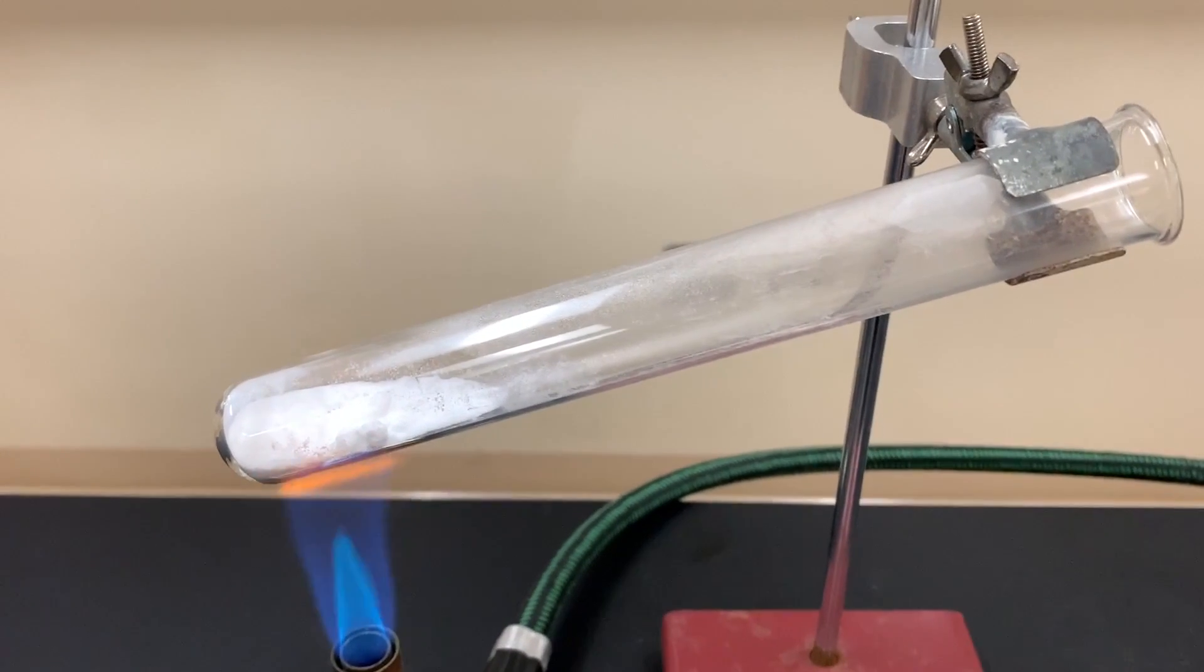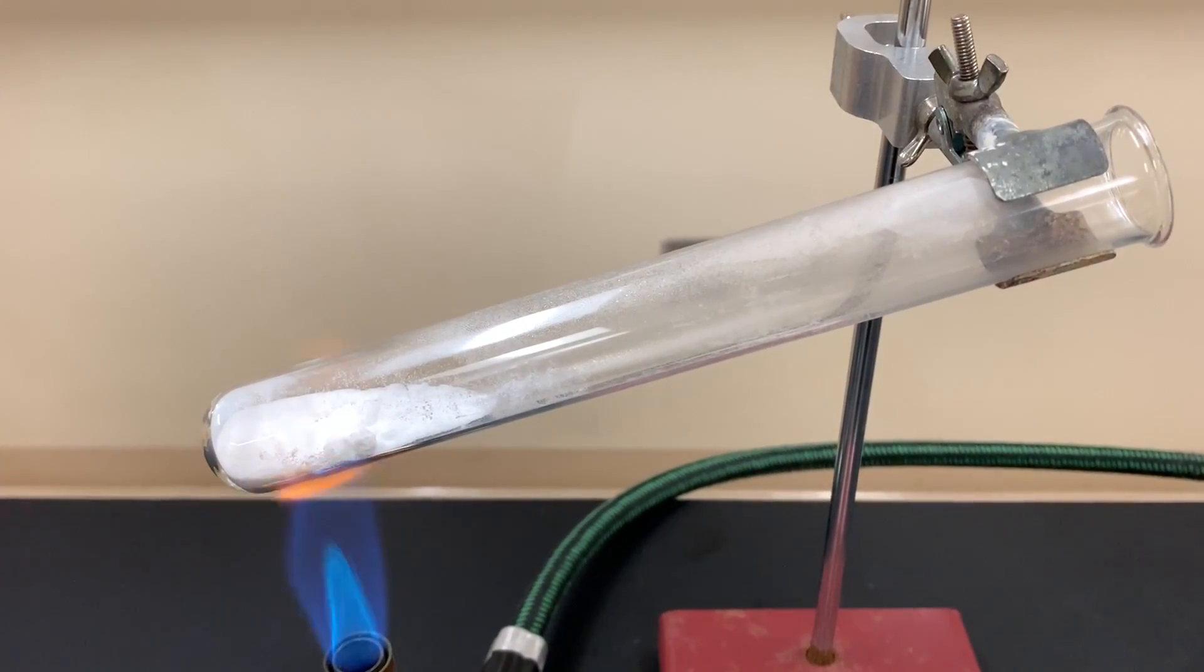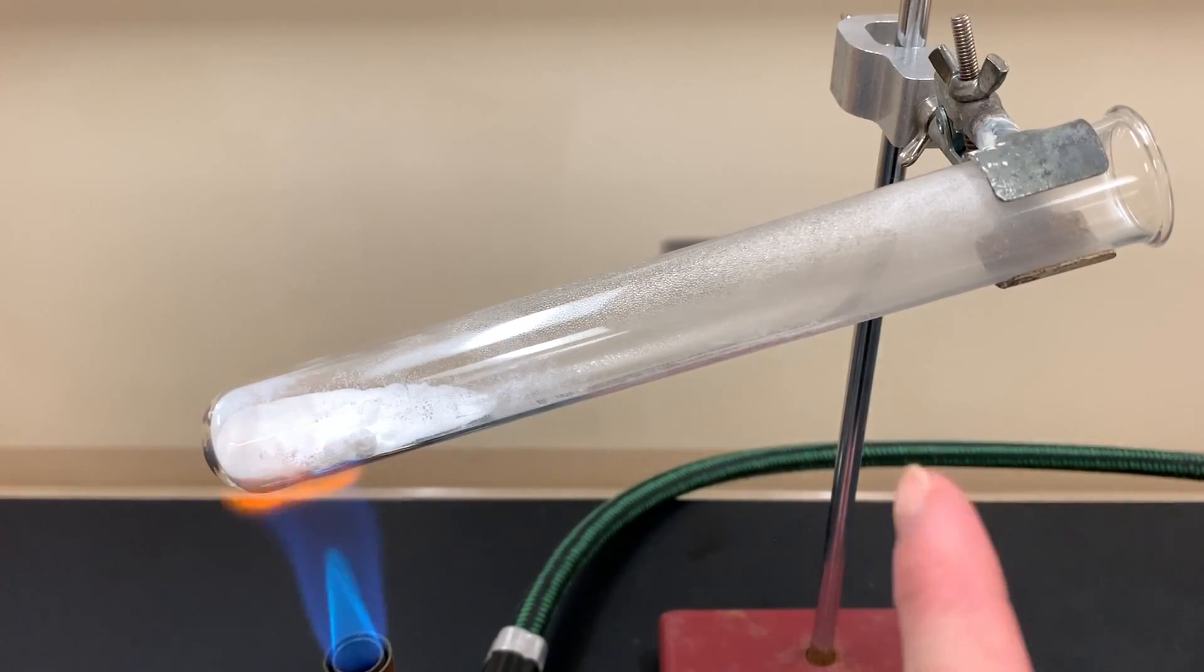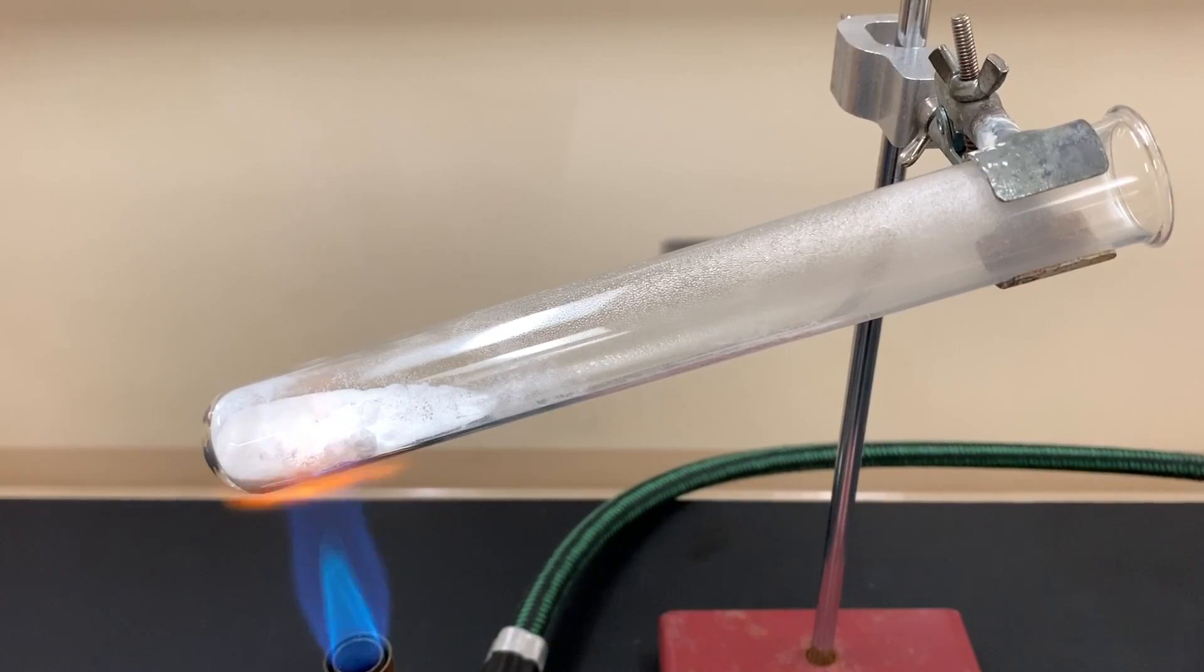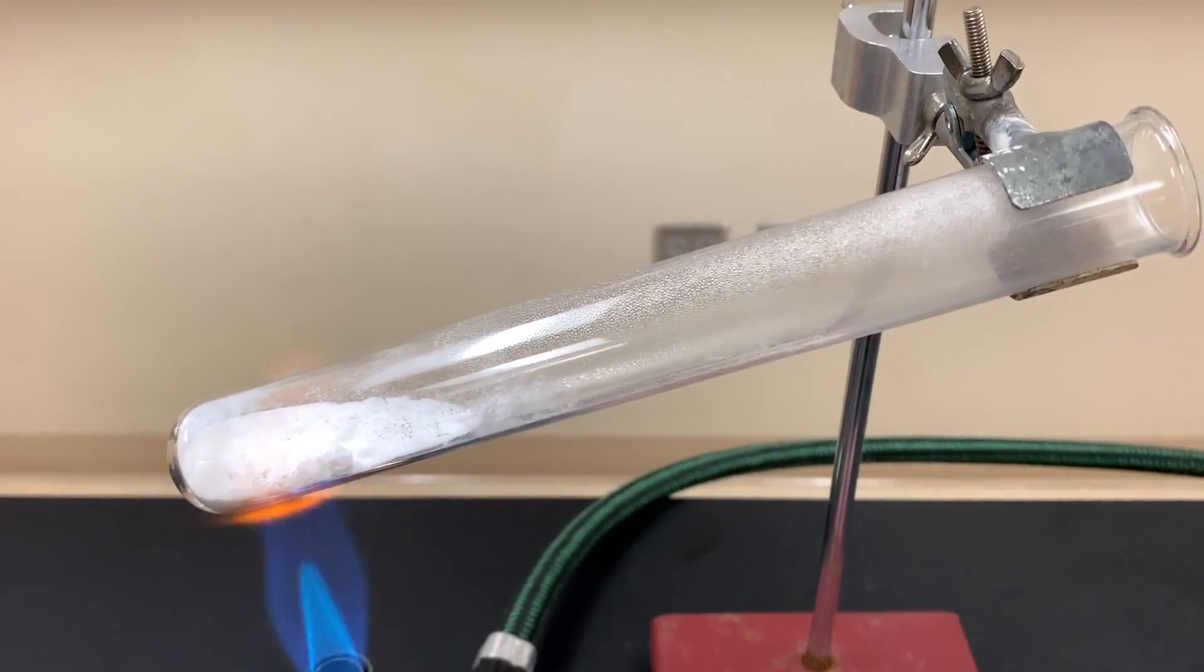We're going to do the same thing with carbon dioxide tests that I did in my copper carbonate hydroxide decomposition video. We're going to look for evidence of water forming on the inside of that test tube and I believe if you look carefully you're going to see that right now.